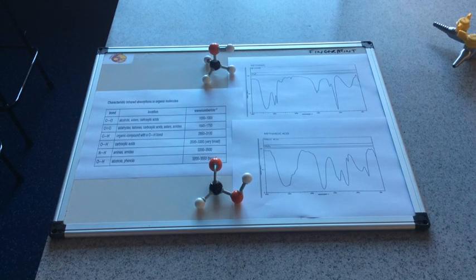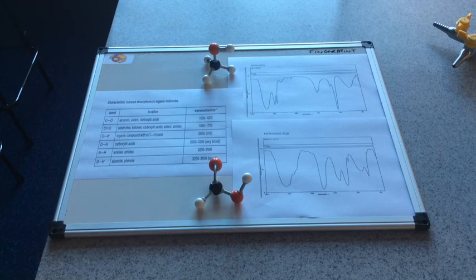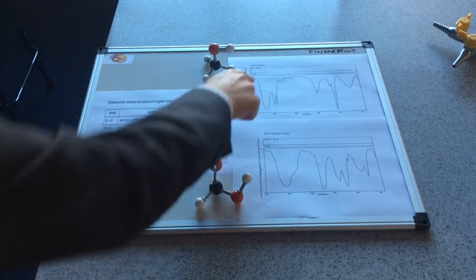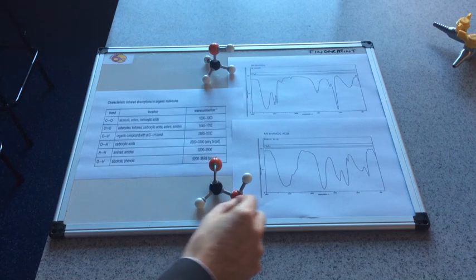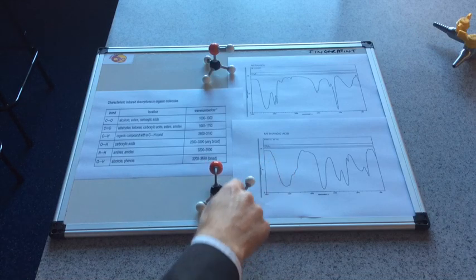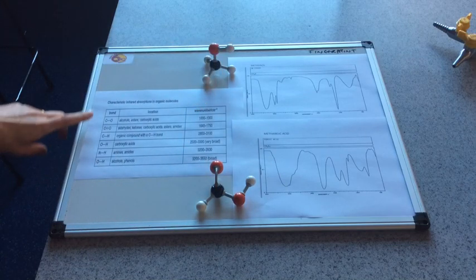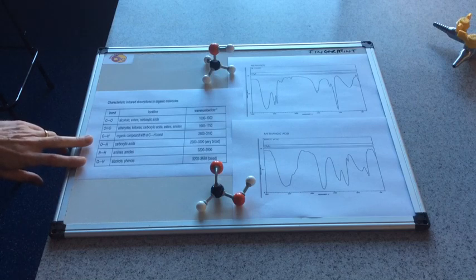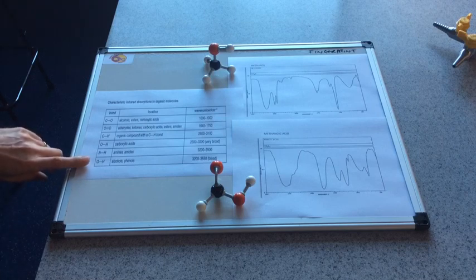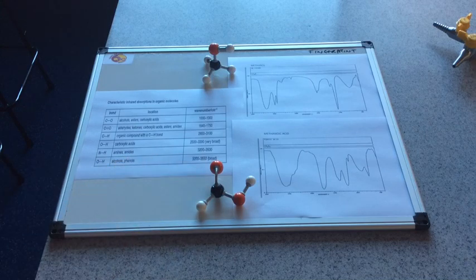I've kept methanol on the whiteboard but I've added methanoic acid instead of ethanol, and we'll have a look at the spectrum for methanoic acid and compare it to that of methanol. So you can see both molecules have an OH bond - we've got an OH bond belonging to a carboxylic acid and an OH bond belonging to an alcohol, and you can see from the table that they absorb slightly different amounts of infrared radiation.